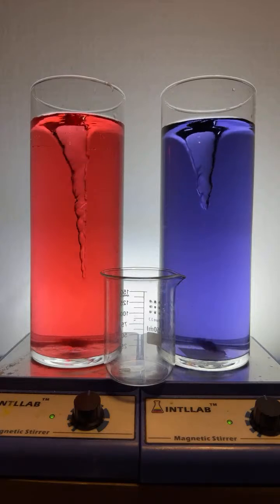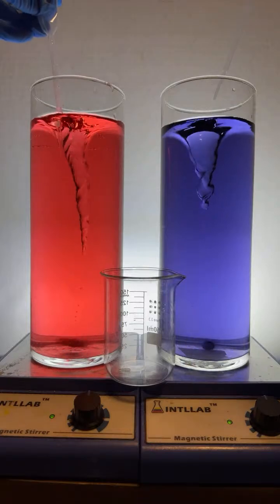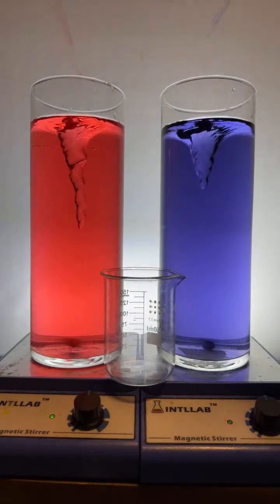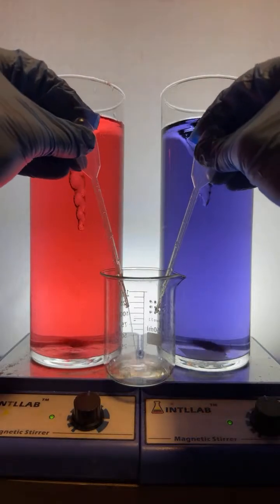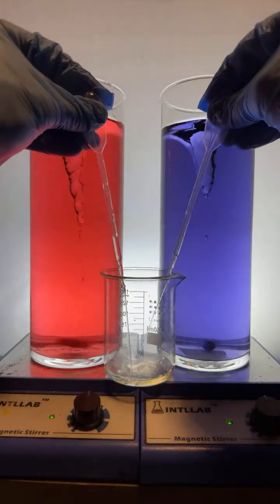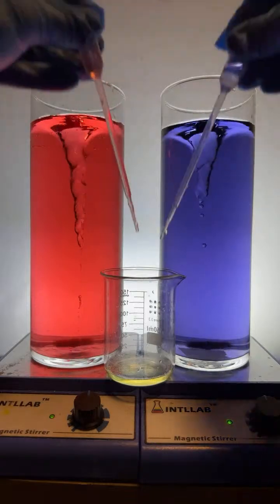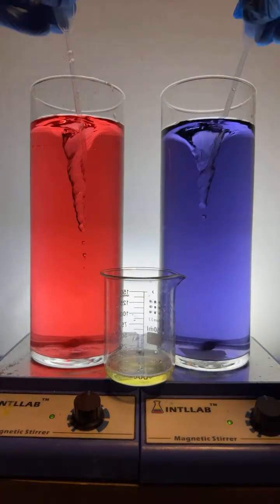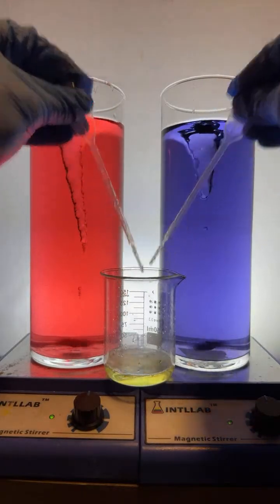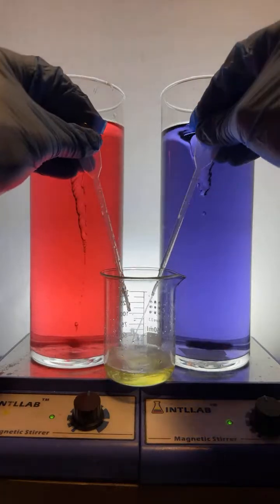So because acids and bases neutralize each other... Here we go. Let's pull a little bit of red from this side, a little bit of violet from this side, and we're going to add them both to this container here, and I'll keep doing this for a while. So I'm adding some solution that is acidic and basic to this middle flask. The acid is the red-colored mixture on the left. The base is the blue-colored mixture on the right.